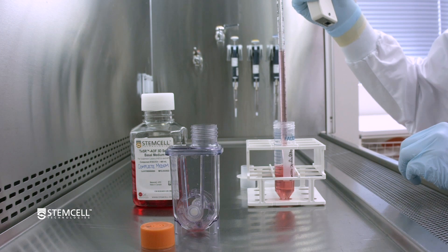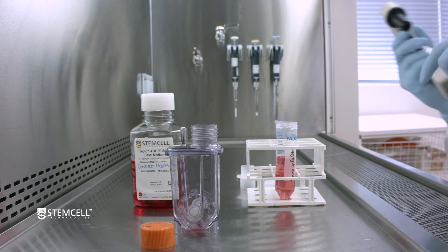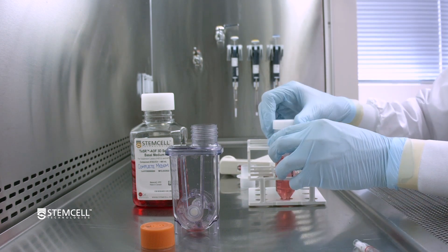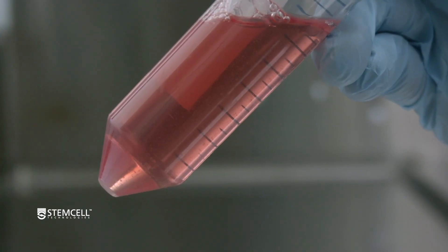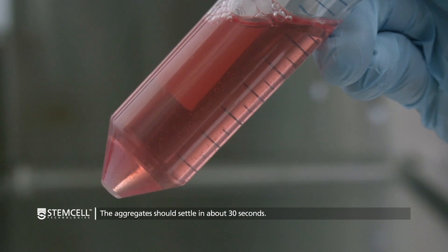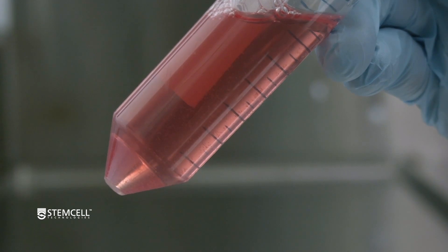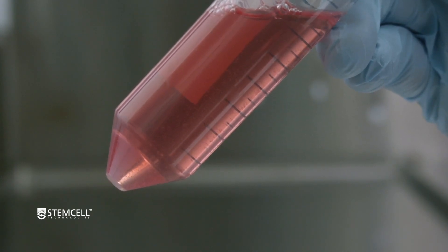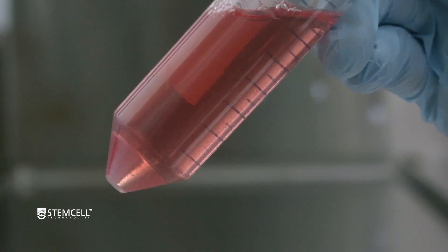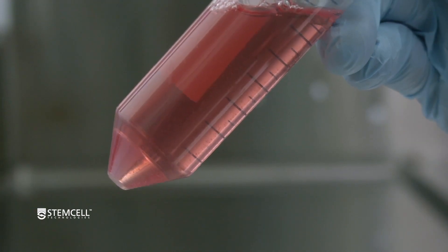Repeat if necessary. Now, wait for the aggregates to settle in the aggregate recovery tube. To speed up this process, hold the falcon tube at an angle of approximately 45 degrees. The aggregates should settle in about 30 seconds. If they are not settling, the aggregate recovery tube can be centrifuged at 300 times G for 3 minutes.